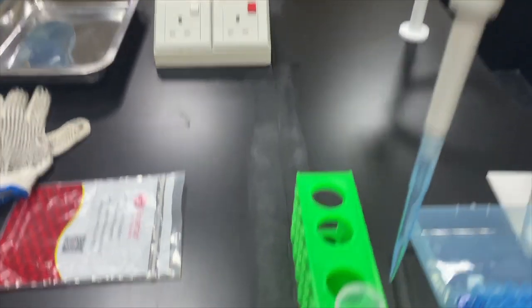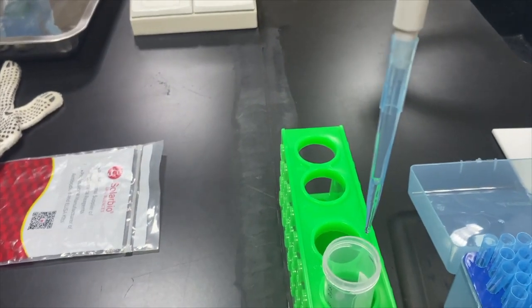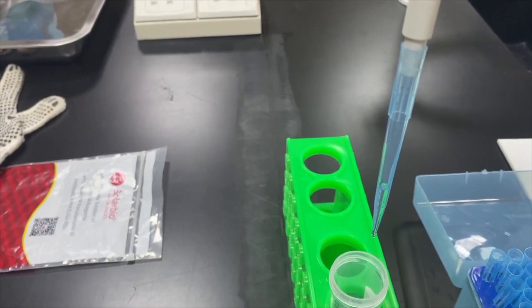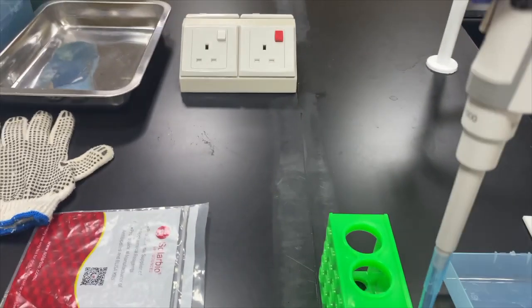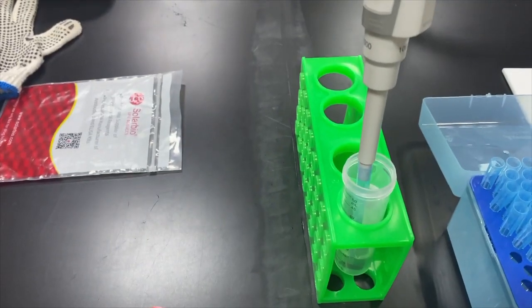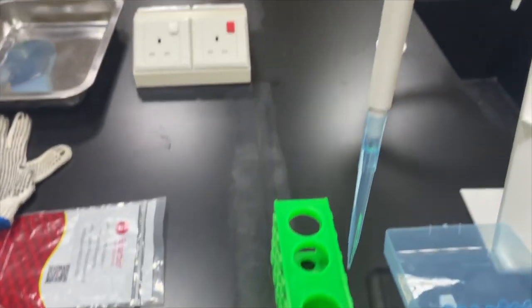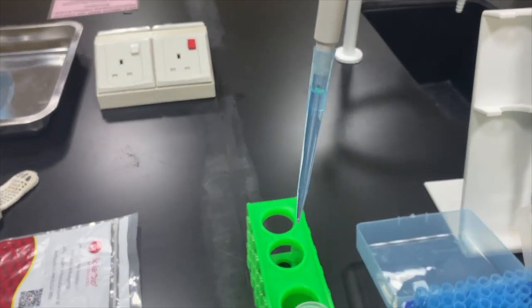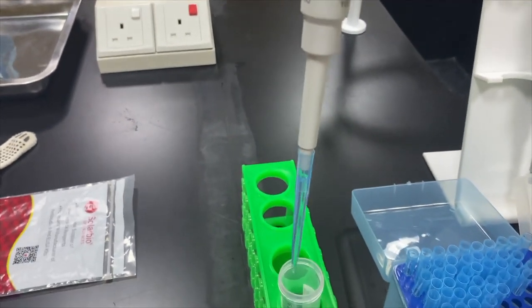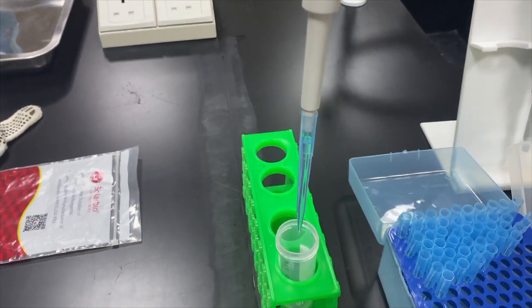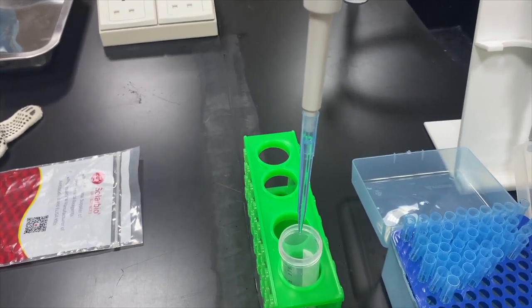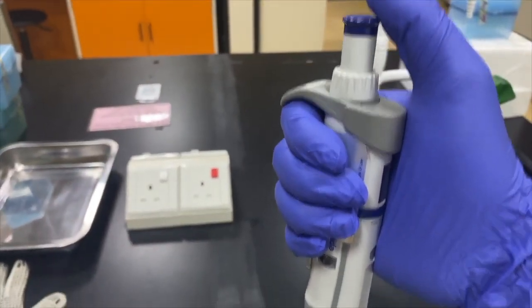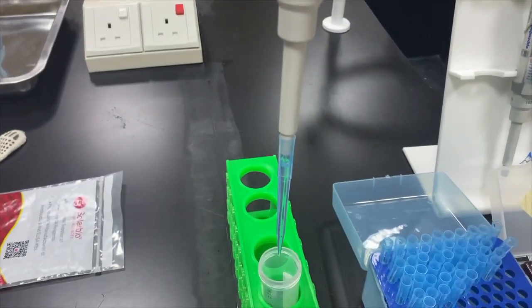So, there will be some part of the liquid which takes maybe around like 100 to 200 microliter. And then you take another to make one milliliter. So, in here, it has more than one milliliter. So, be careful if you want to dispense. You have to remember that there are two stops of the liquid that's taken. So, you just push the button only one stop. Like this.